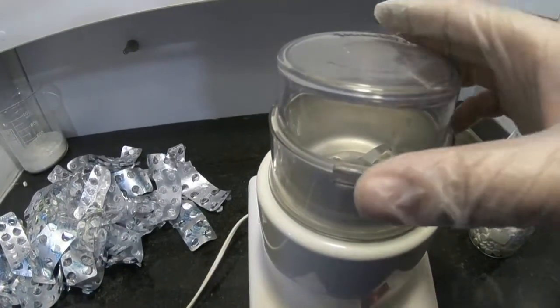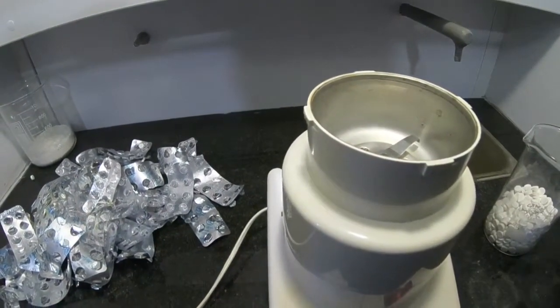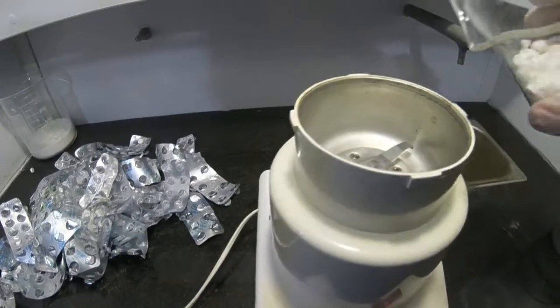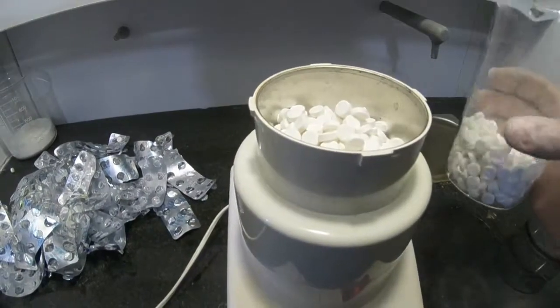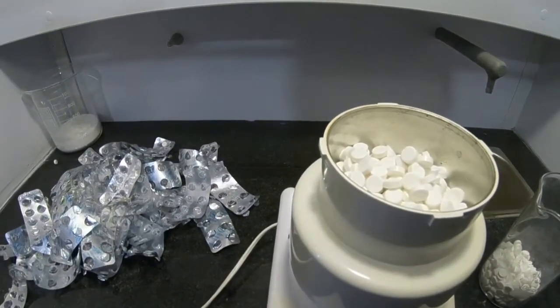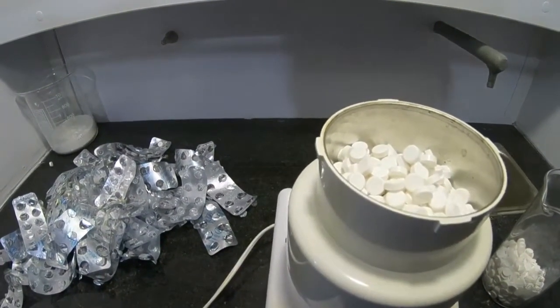I'm going to use this blender to powderize the pills. Sorry for the noise.